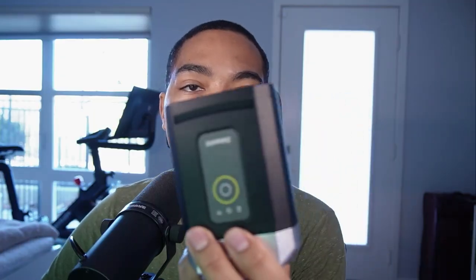But I want to show you what happens chemically through the lens of a near-infrared spectrophotometer as a banana goes from green to yellow. This process is known as ripening, and generally what happens is that larger starches are broken down to simpler sugars like sucrose and fructose and glucose, and thus the banana appears to be much sweeter. Tannins are also converted, and so generally this is a very pleasurable process because now the banana is much sweeter and fun to eat.